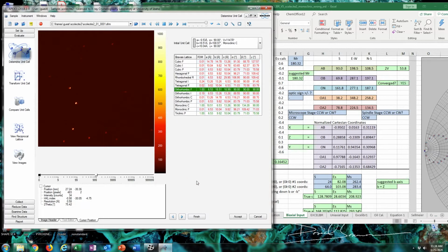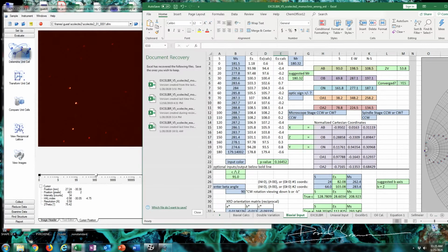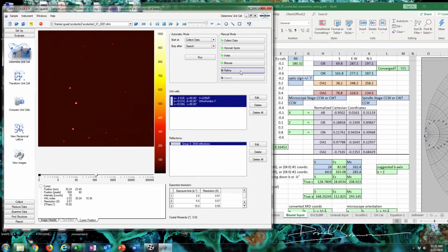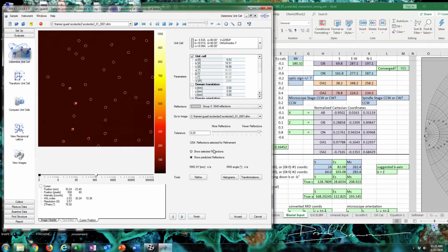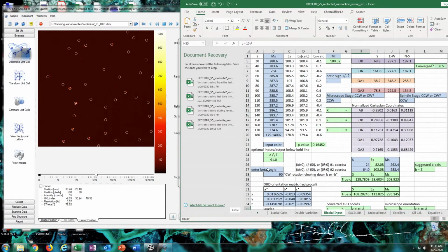using information from the internet about scolecite and information I figured out from the optical crystallography we did using the spreadsheet. So we pretty much determined that Z is B, and the long axis of the crystal is either A or C. So that just leaves one other axis to find, really. And because the beta angle is 108 or 109 or so for the conventional C lattice setting for scolecite, we can just use a rotation matrix to try to find that axis.